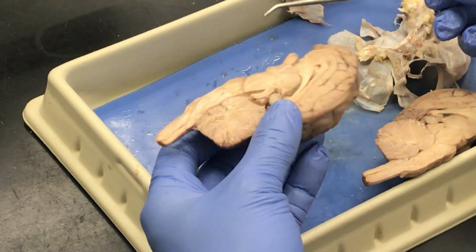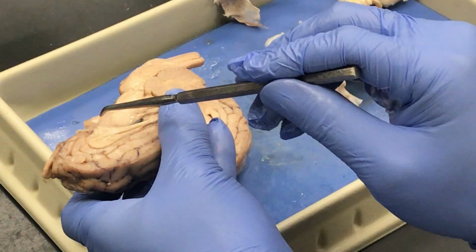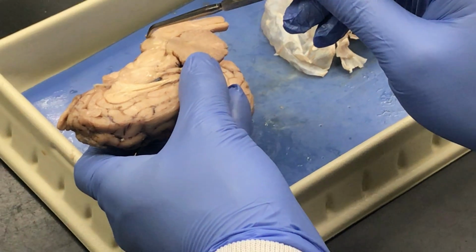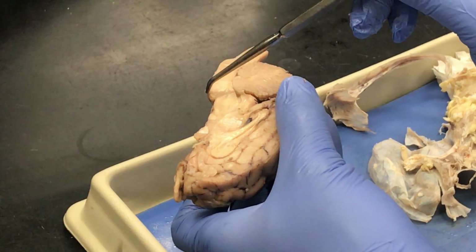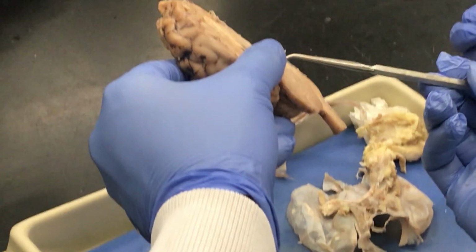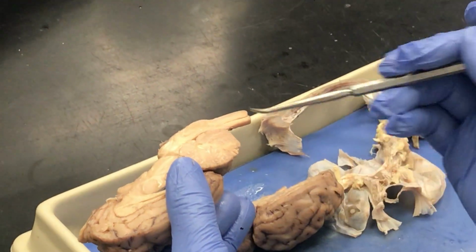And the pons. From the cerebral peduncles, you just move down the brainstem and you see this bump sticking out right here. Again, not as large as a human structure, but that little bump inferior to the cerebral peduncles, this bump here, is the pons. And the cerebellar hemispheres. We sliced the cerebellum in half, so you see the two sides of the cerebellar hemispheres.